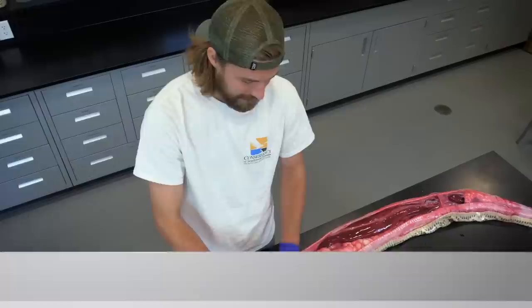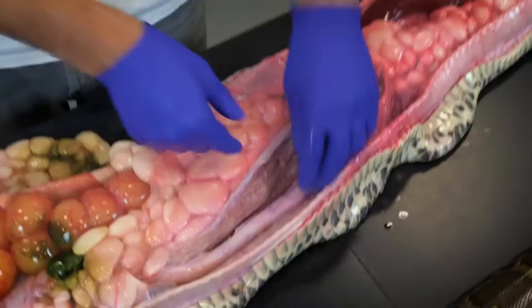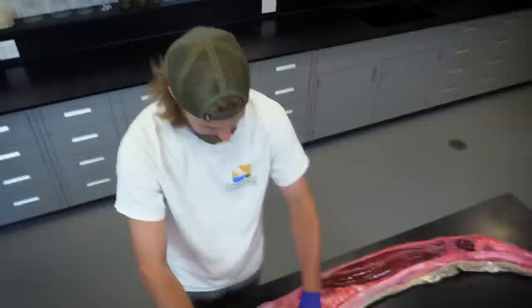We're going to take a look at the digestive system. The first thing I'm going to open up is the stomach to show you if it has anything inside, or at least show you the really cool adaptations of the stomach. When I open this up, you can see there's really nothing inside except for some gooey material. All these wrinkles inside, all these folds, will expand when it swallows a large prey item — they're essentially for surface area. This stomach is relaxed right now with nothing inside.